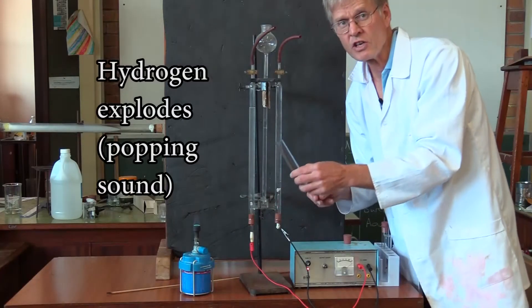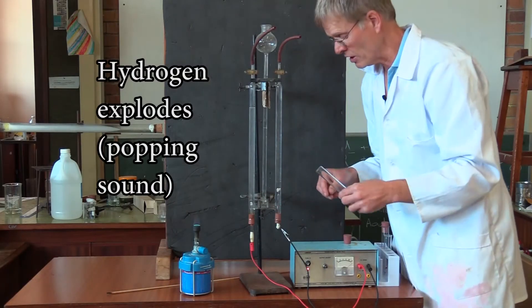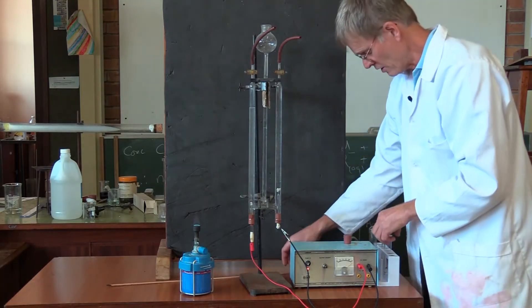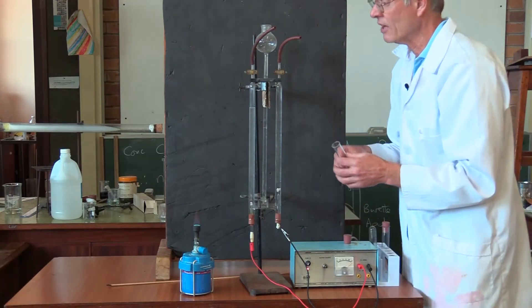The characteristic popping sound of hydrogen exploding. On the other side, we're going to try and collect the oxygen.